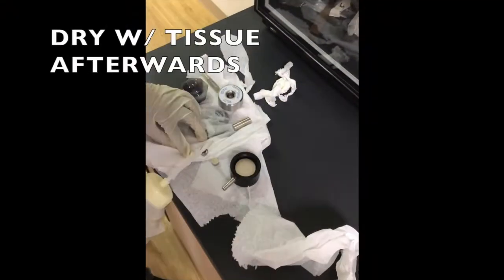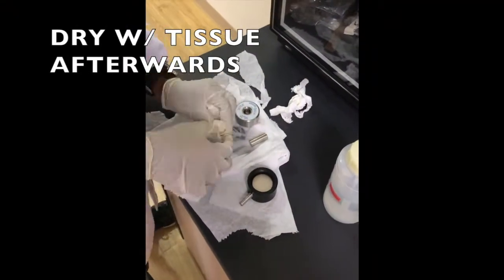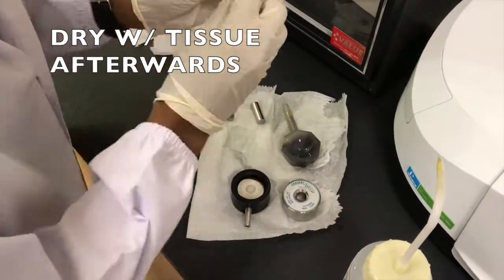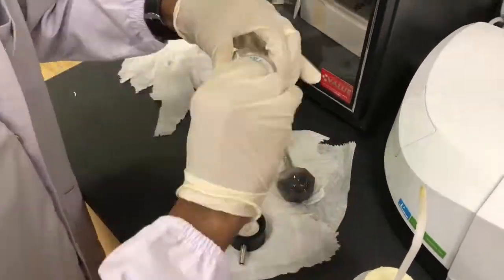After this, wipe them dry using tissue. Latex gloves must be worn to prevent chemical spills on skin and grease from staining the equipment.